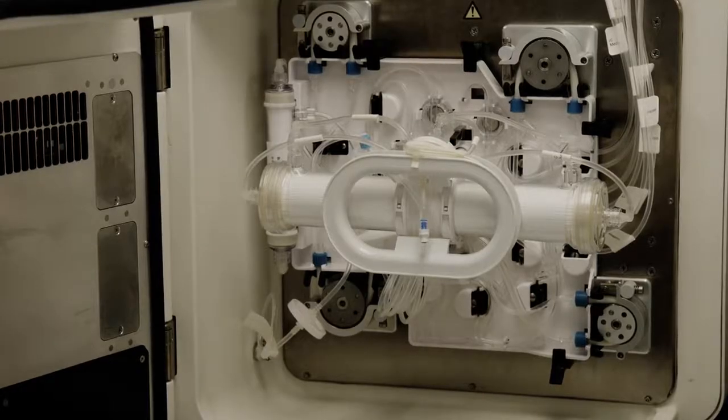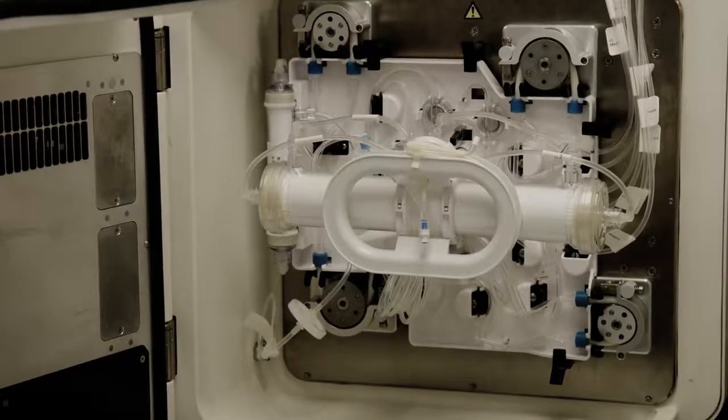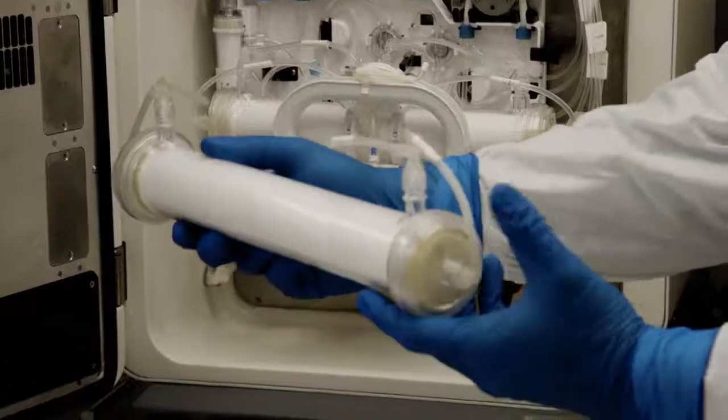The bioreactor is actually where the cells are going to reside. And we have a bioreactor cut out of another disposable Josh is holding up here.